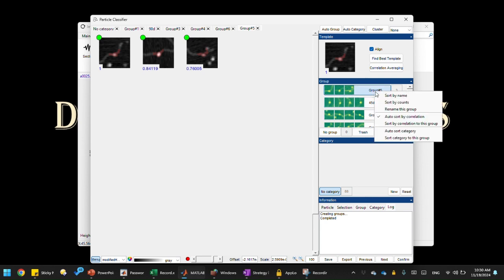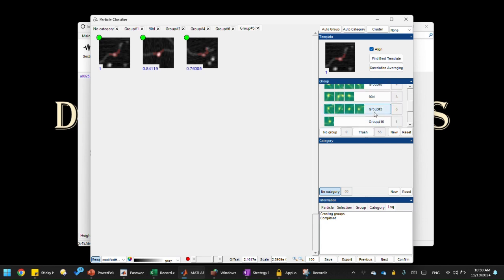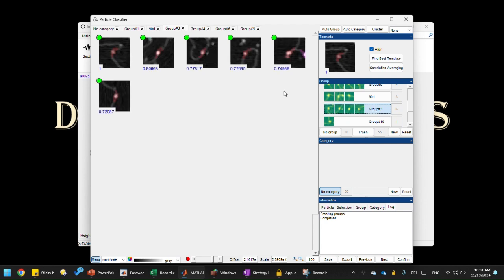Yeah, I mean, we can just rename this. Let's say 45D. This is not a copy of this, it's similar to that. And we already said group 3 is unbent state, right? Low bent state is maybe like 30 degrees or something. Unbent state is 0 to 30. Is it 0 to 30? Let's see. Yeah, there's some 0 degree. You probably have to separate them out. Some very low bent state, I would say. Yeah, it's a 30 degree or something. Let's rename that 30D.